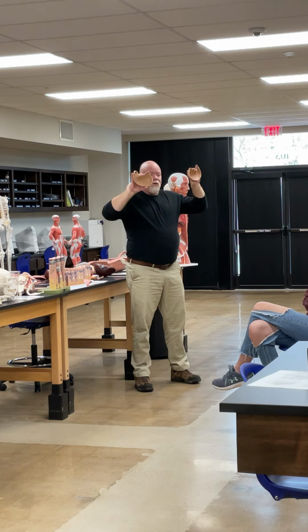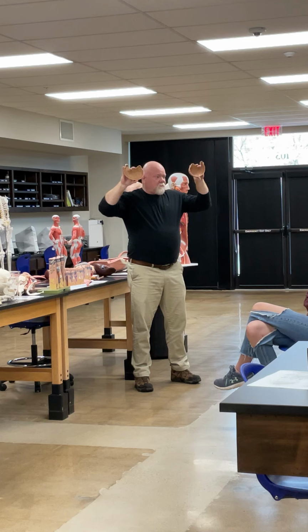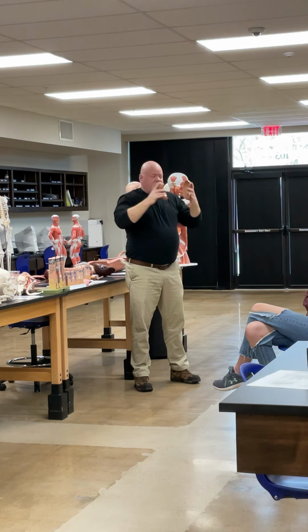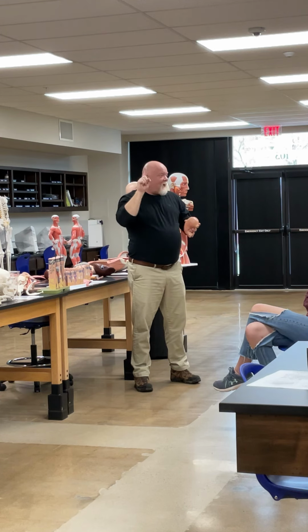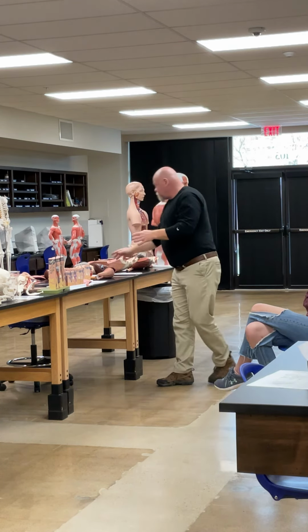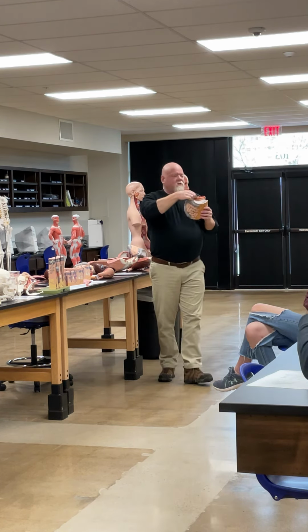When you open it up, it's full of ridges, okay? This is gonna help move the fluids along. We call these the gastric rugae, okay? Gastric rugae, okay? There's also palatal rugae in the roof of your mouth where it's nice and bumpy, okay? And we'll see it really well in the cat when we look at that. But that's the stomach, so there's several things to know on the stomach. Then from the stomach, we go into the small intestine. So you can see that this is gonna be the duodenum.